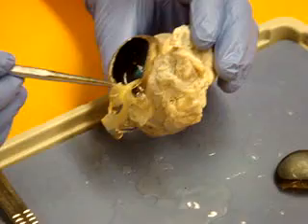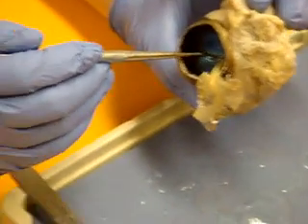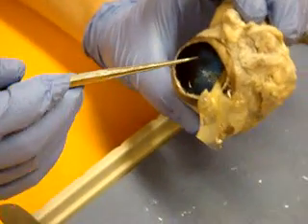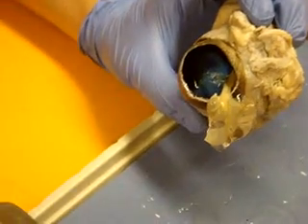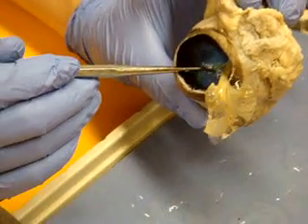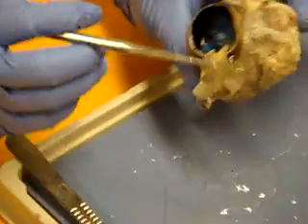Look right here — this area would be the fovea. That's the focal point of very high visual acuity, so things you need to see really clearly and precisely get focused right through there. I wouldn't normally ask you that on the sheep's eye because a lot of times it doesn't show clearly.